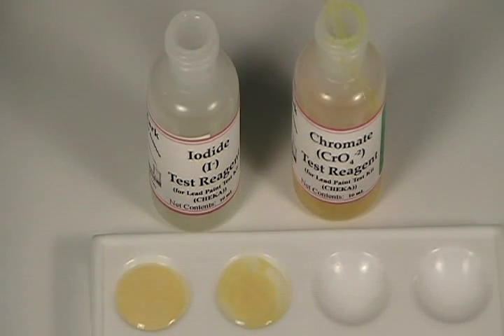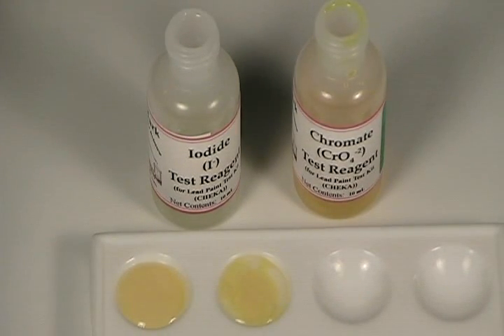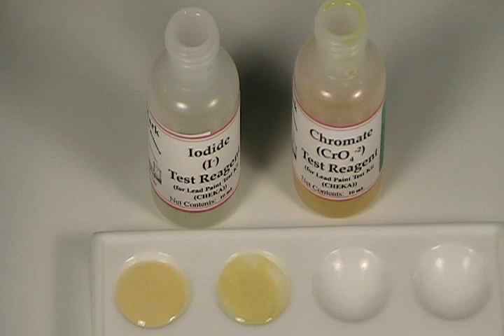I don't know if you can see yellow, but it's clumping on the bottom in little granules. So at this point, we are essentially 100% sure that lead was present in that sample and in very significant amounts. You should now have a pretty good idea of how to test paint for lead. One caveat: treat any results you get as tentative. If you do get positive results, contact your local extension agent or public health department for advice and more information.